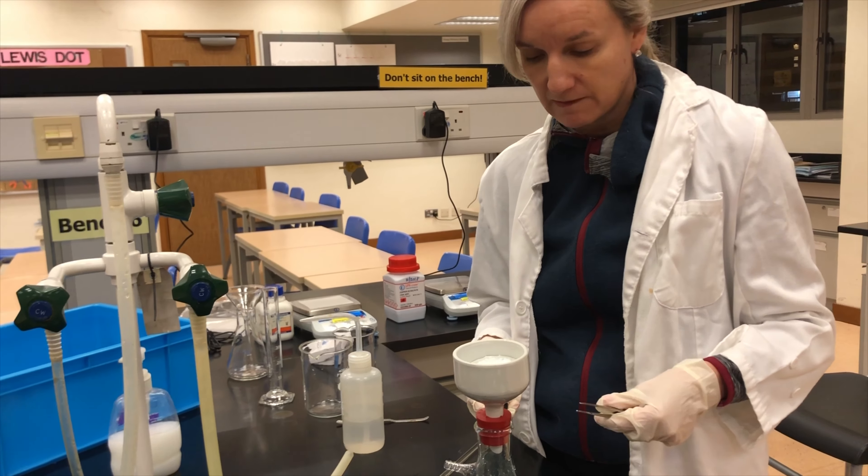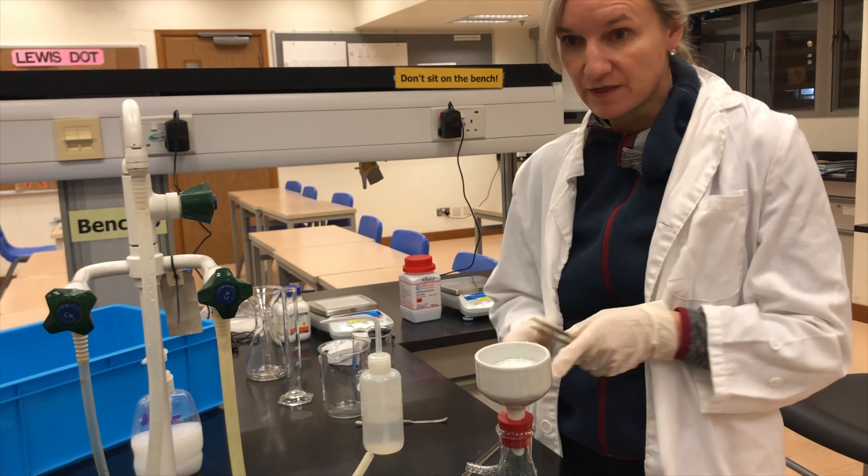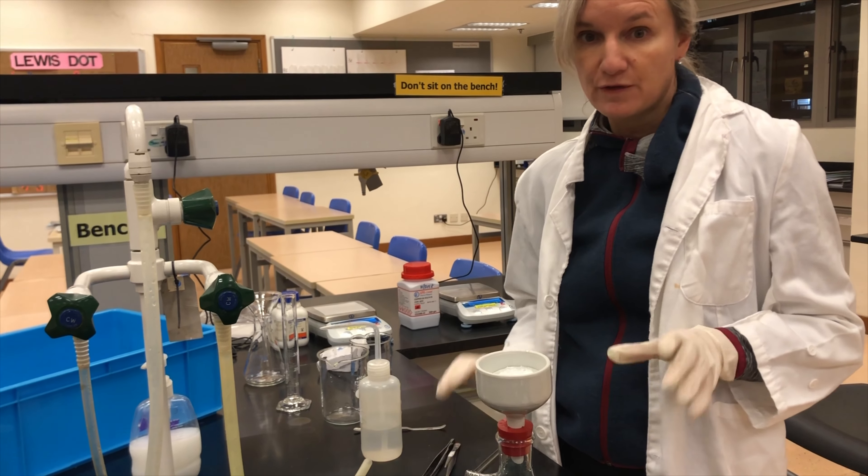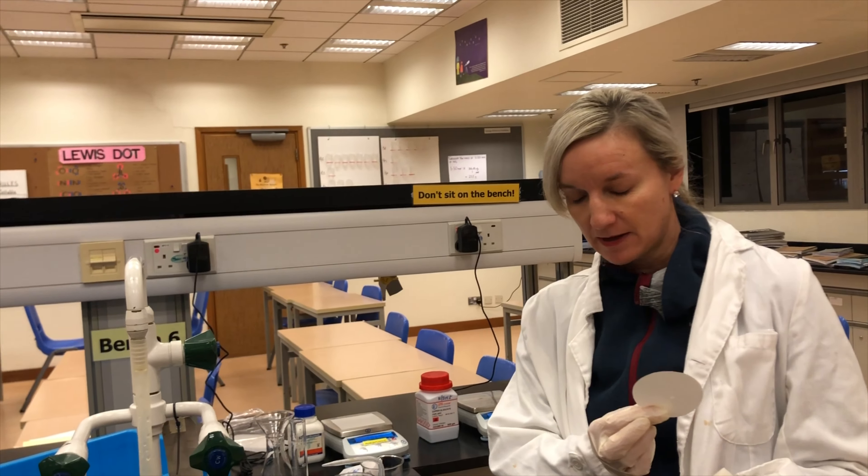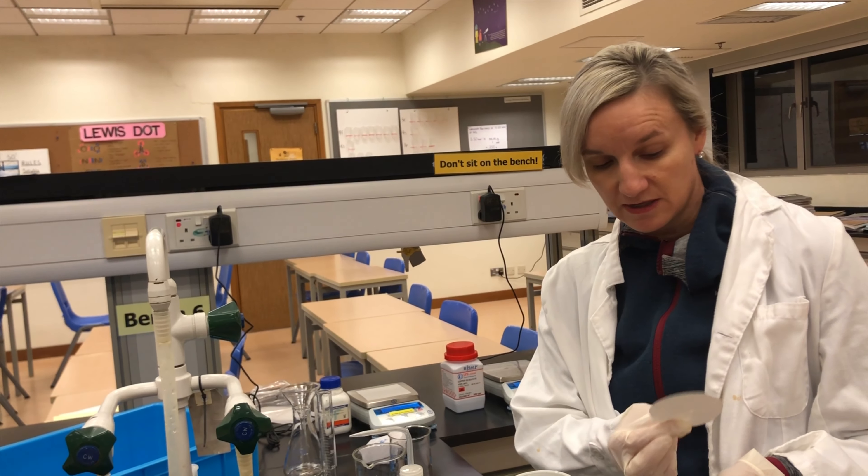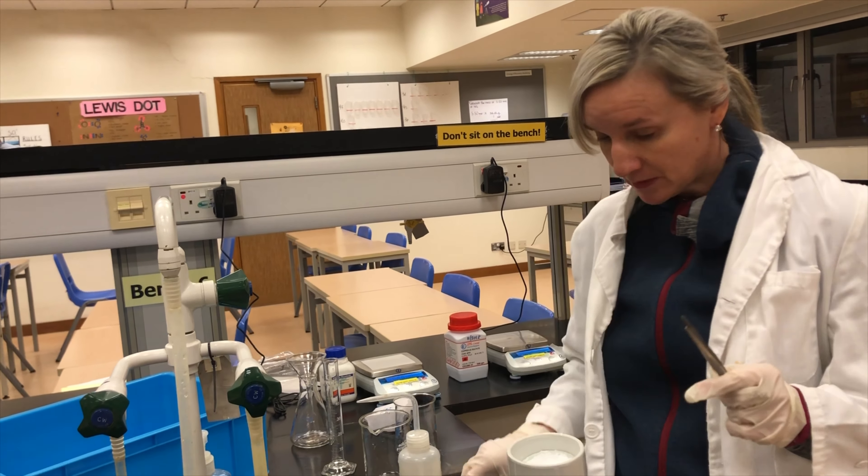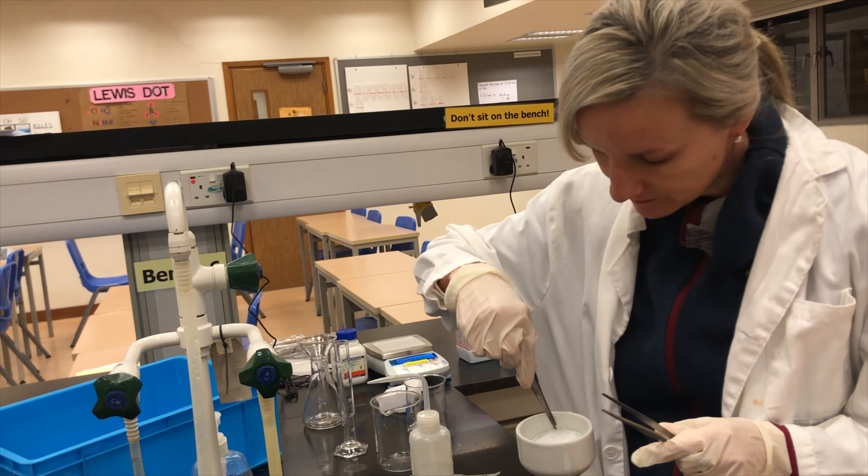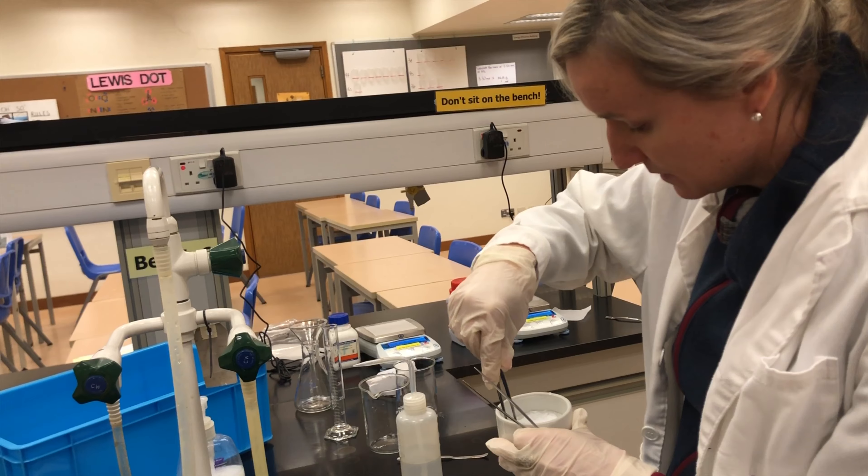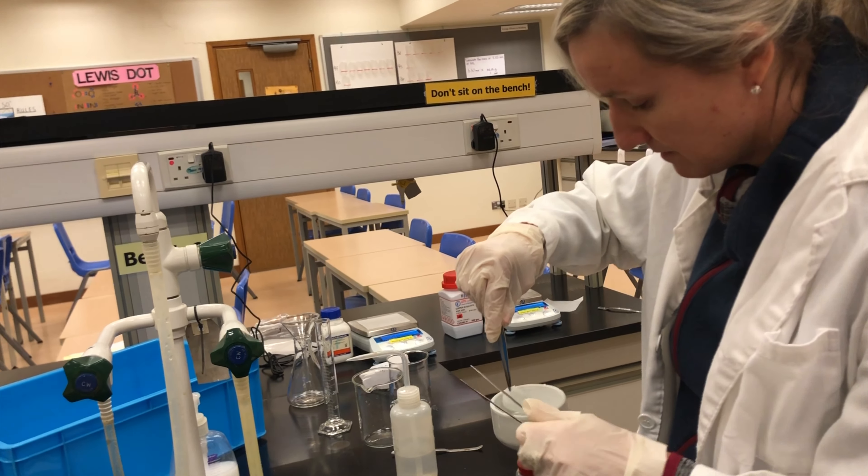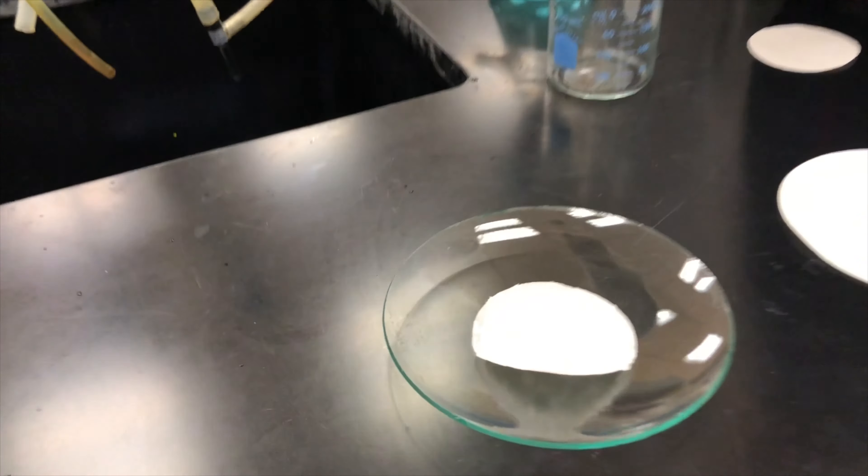Now there was one thing I forgot to mention before I did this experiment. You need to weigh the piece of filter paper before you begin the experiment because you're going to have to need to use this in your calculations. Because if you actually look at when you remove this piece of filter paper, you can see that the precipitate is going to be almost impossible to remove off the piece of filter paper.